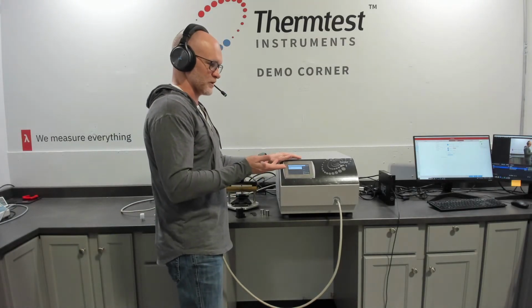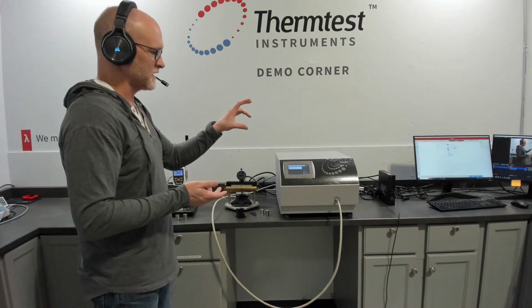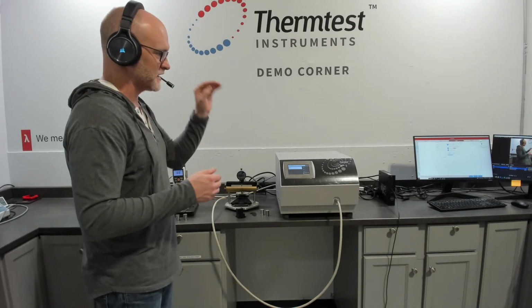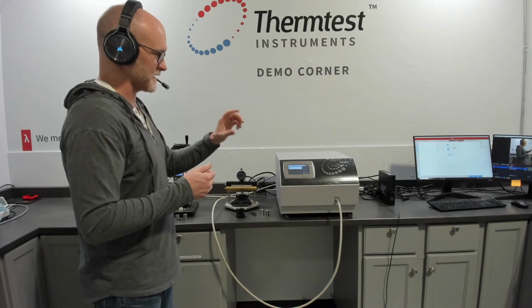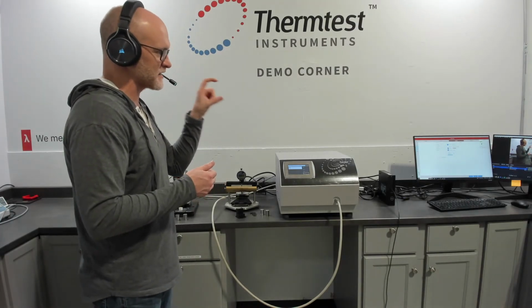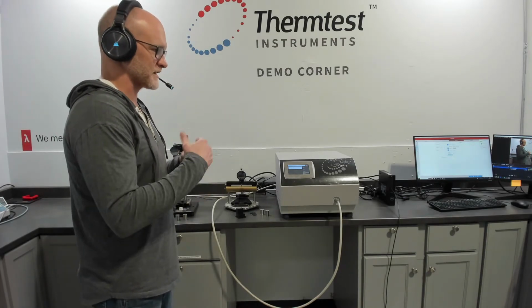And why is that important? It's because it characterizes the portion of time that represents the heat traveling through a layer of kapton, which is the sensor, a layer of contact resistance, which exists in every sensor to sample configuration, and into the material. So by characterizing that region, you don't have to manually select it. That's one of the key capabilities.